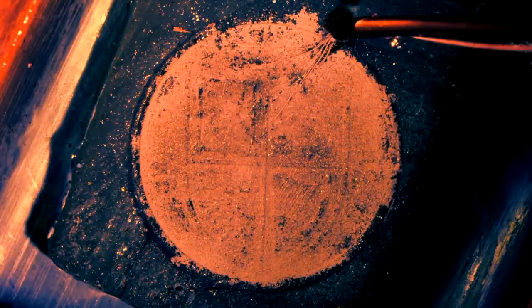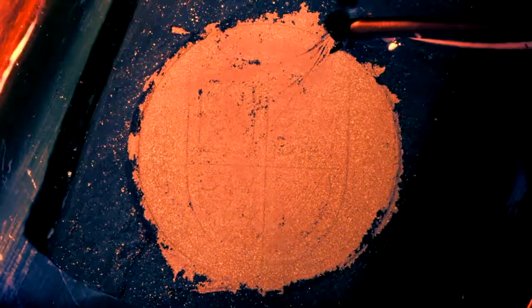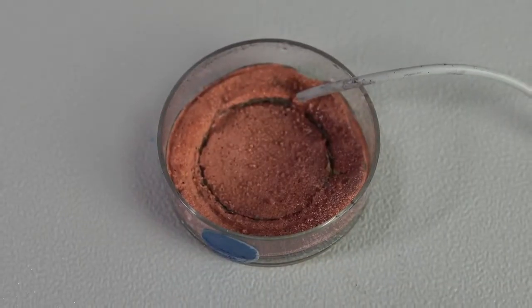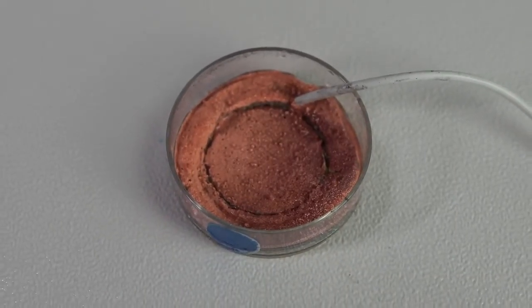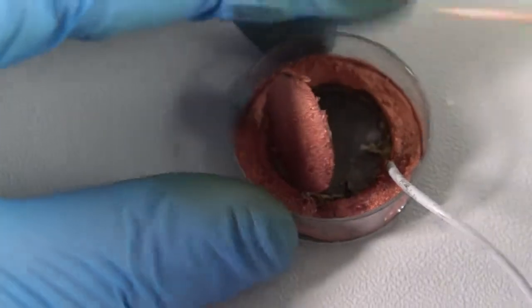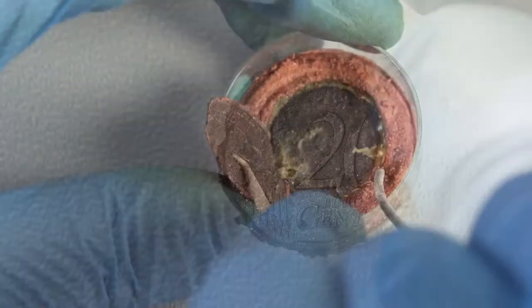Therefore, lots of copper layer grows on it, making the coin stronger. Twelve hours later, pour the solution out from the Petri dish, wash the coin with water, and take out the Play-Doh. The coin looks almost like a real coin.